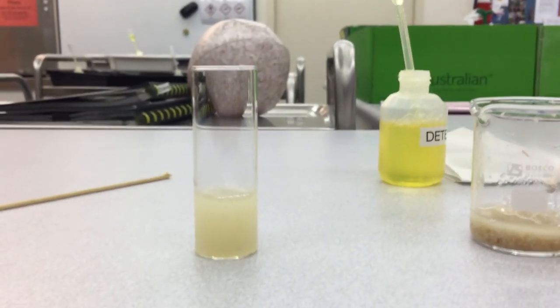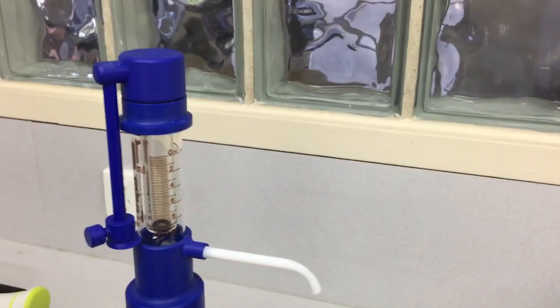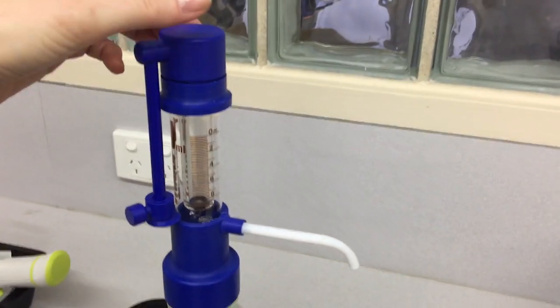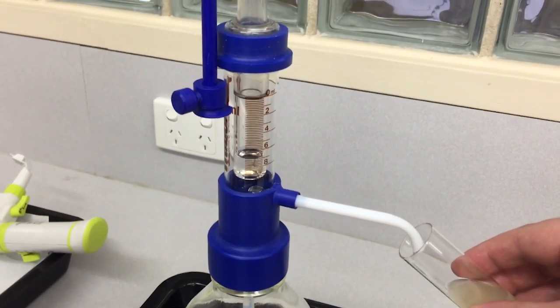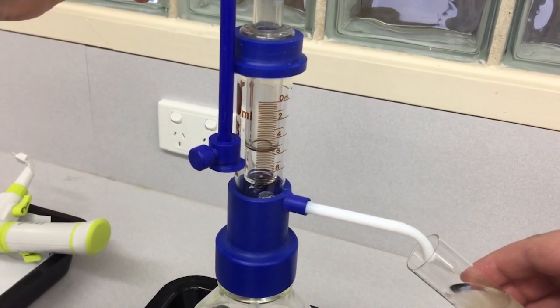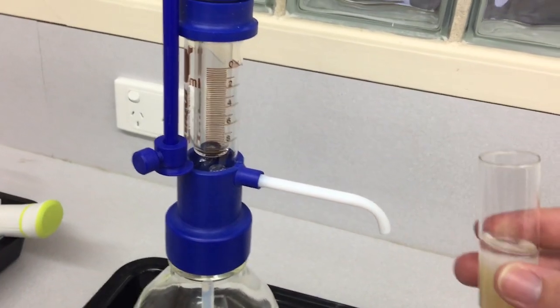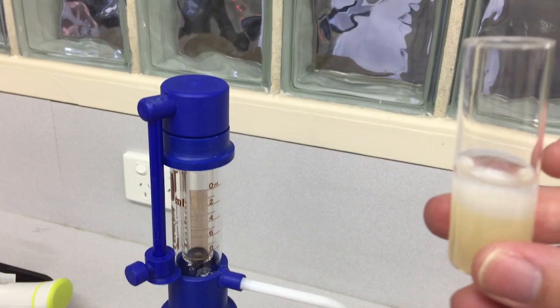Then what we're going to do is we're going to add some methylated spirits. So now we're going to add 10 milliliters of methylated spirits from an automatic dispenser. So I'm going to hold the vial up underneath the dispenser here at an angle so that the alcohol can run down the side of the vial.